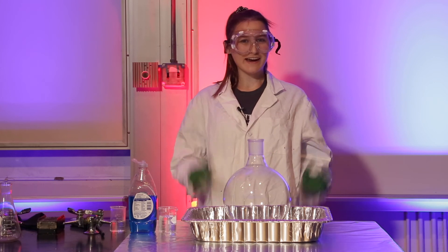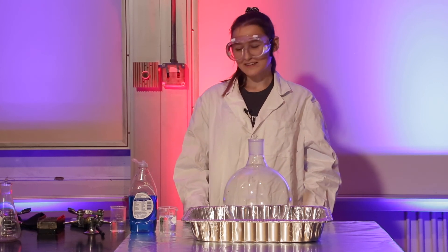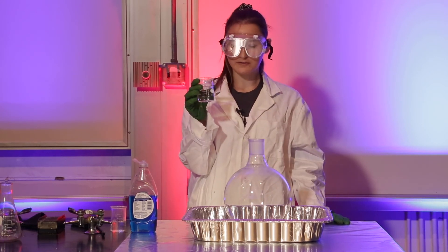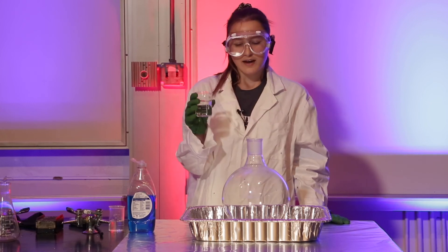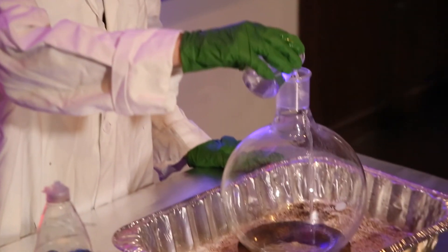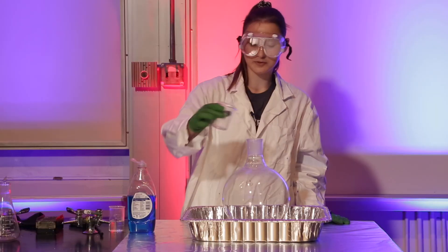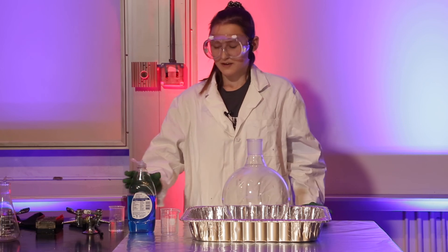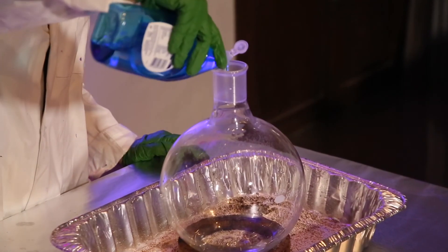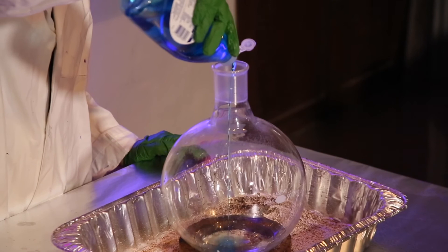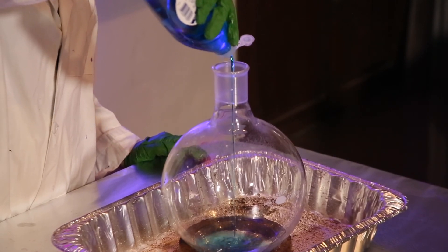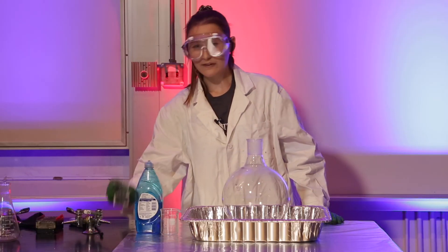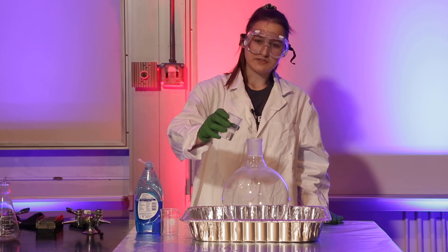Hi, welcome back to Ashley time. I'm going to be doing elephant's toothpaste. This is called hydrogen peroxide. I've carefully measured it out for you guys, so there shouldn't be any problems. I'm going to pour it into this flask now. Essentially, hydrogen peroxide is going to break down over time, but it's pretty slow and I'm impatient, so we're going to speed it up. I'm also going to add some soap just so we can get some bubbles to see the reaction easier. Now I'm going to add the catalyst and we're going to see the elephant's toothpaste form.